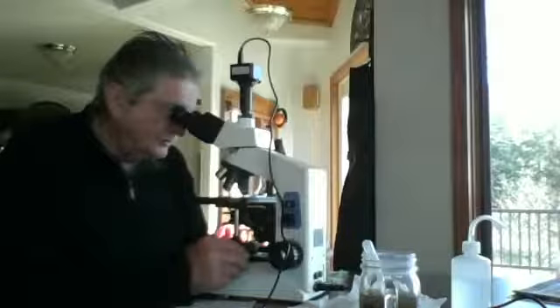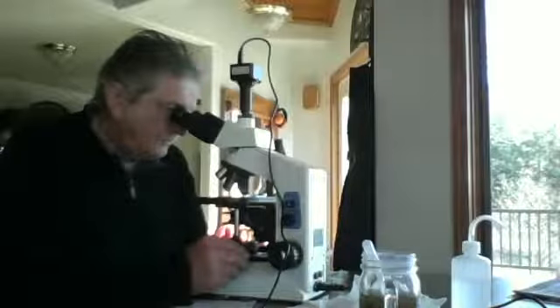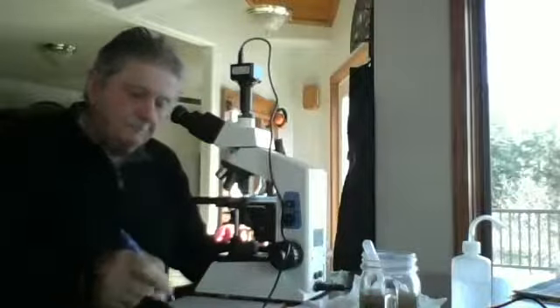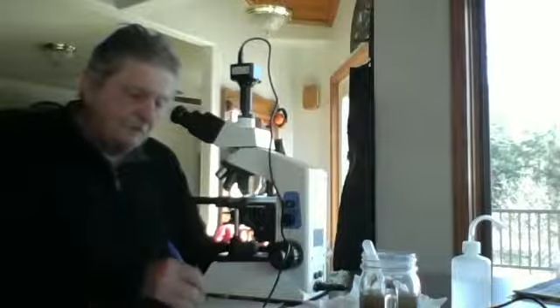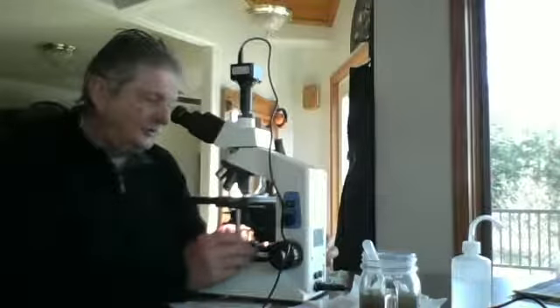Flagellate moving around, picking on some organic matter in the compost tea drop. That completes reading area 4. Now I'll move down to reading area 5.